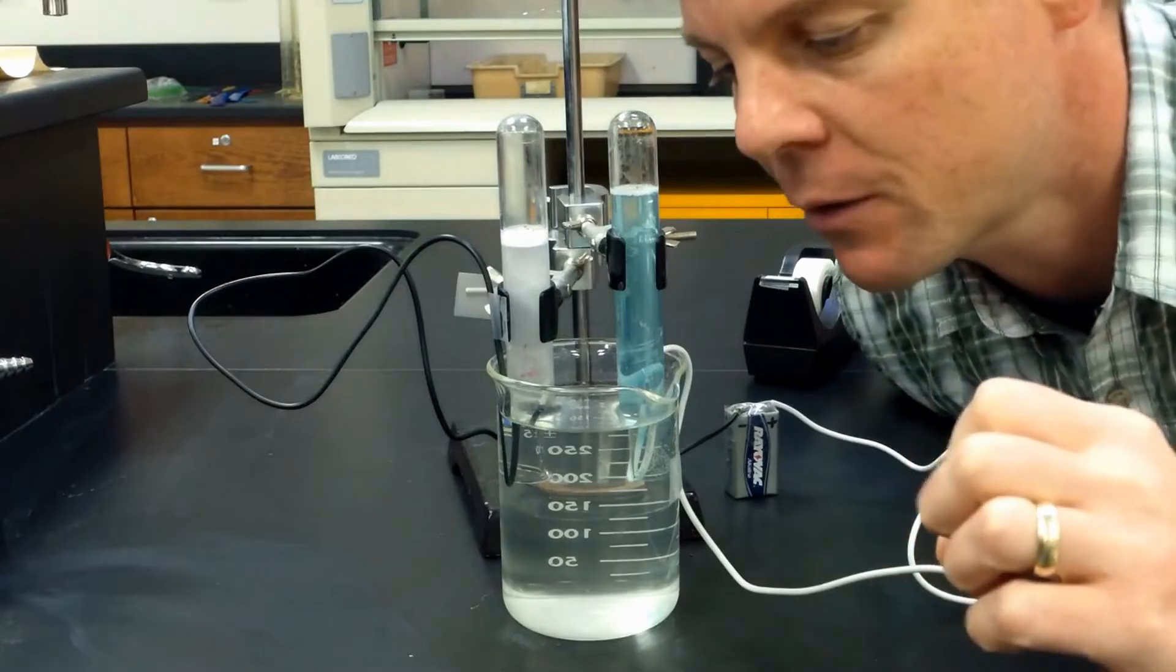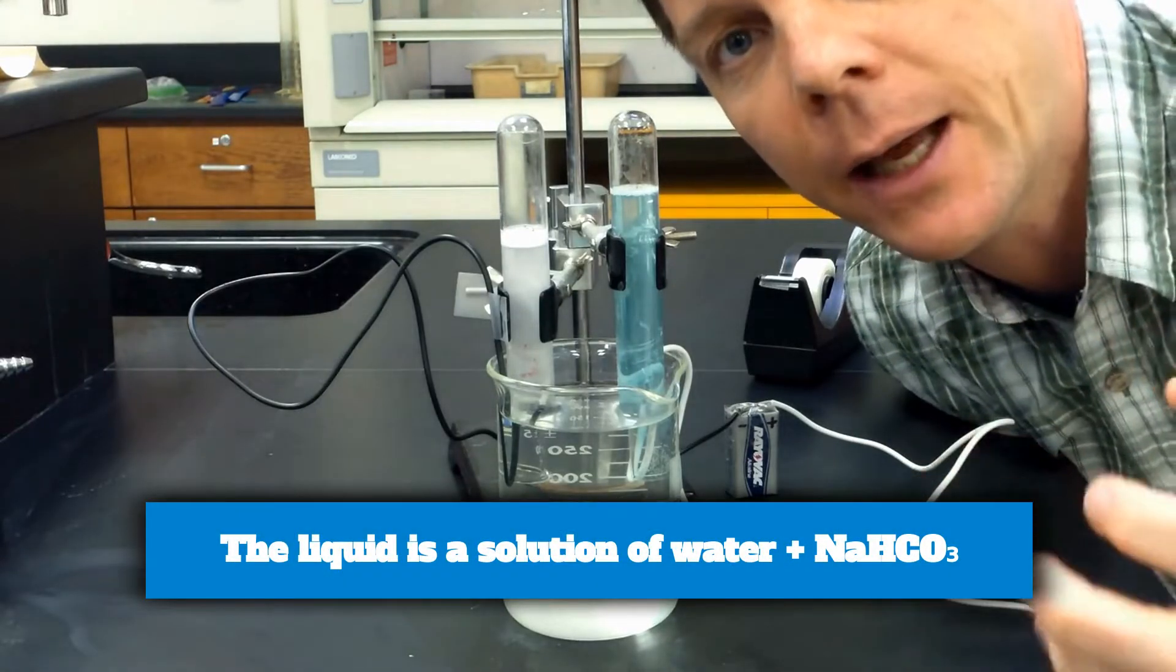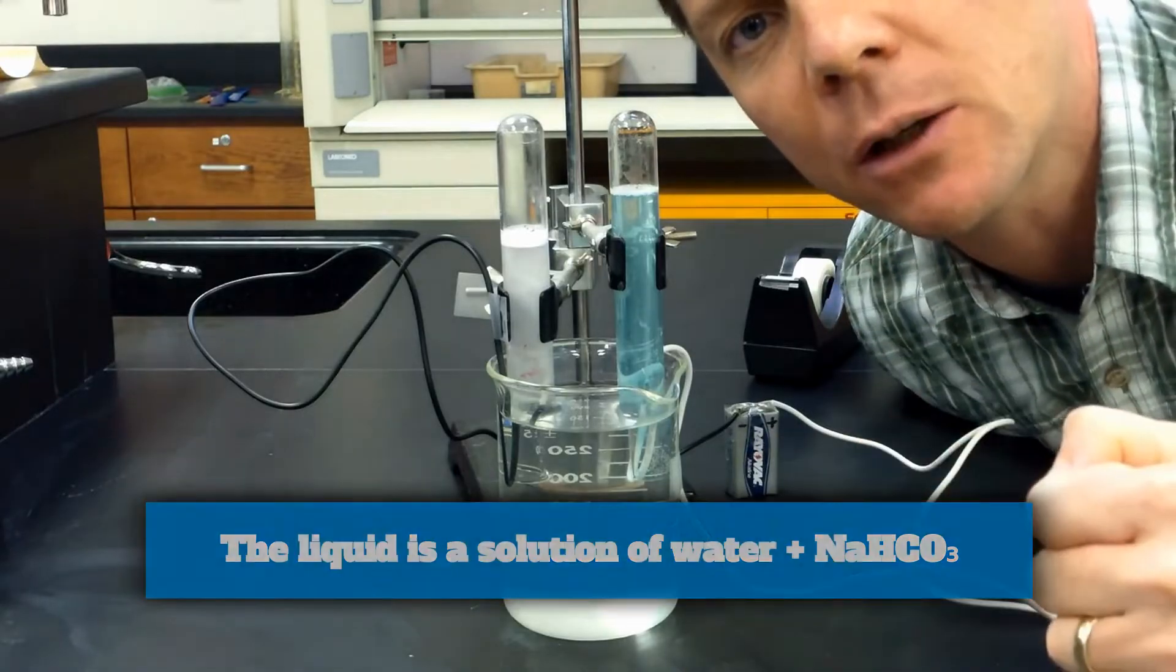The experiment looks like it's running pretty nicely here. The reason why this works is that I have added an electrolyte to this beaker of water.